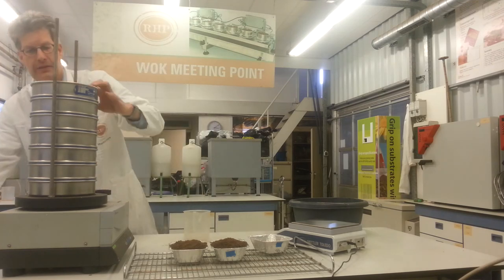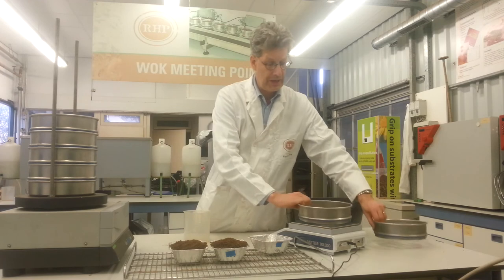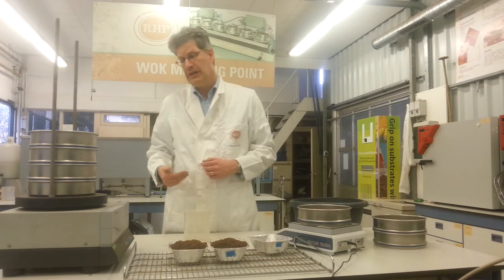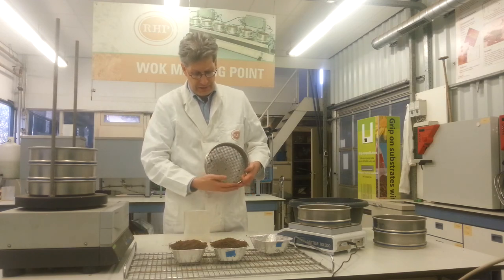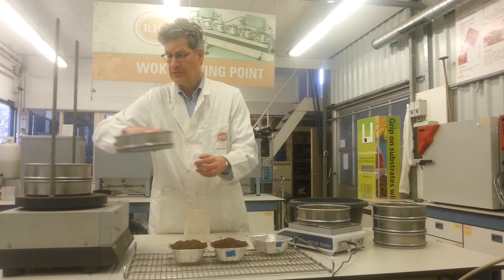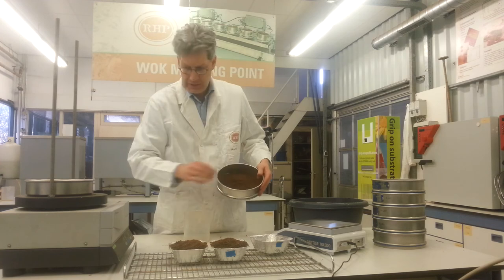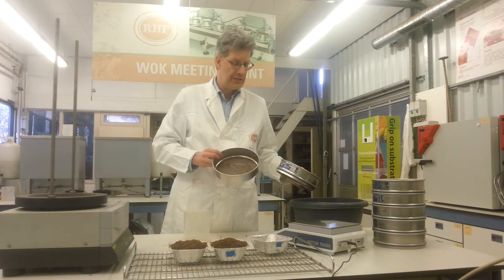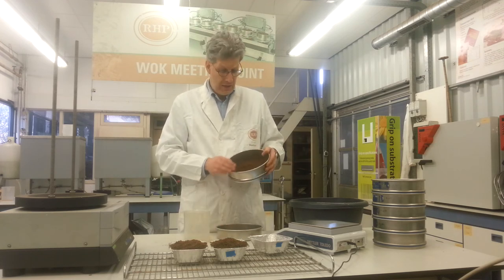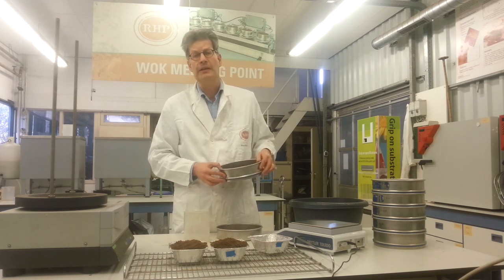This material is very fine, so we do not find anything on the top screen. But we weigh all the sieves — we already know the empty weight and can weigh them part by part. You can see that finer material comes out further down. You measure the weight of each sieve in sequence down to the bottom. We see more fine material in the 2mm screen and some in the bottom pan. This is a demonstration and the material is not properly dry. Normally we should find more in the pan. When material is moist, it sticks together and will not pass the screen far enough. Therefore, air-dry screening is very important when we want to determine exactly the particle size distribution.